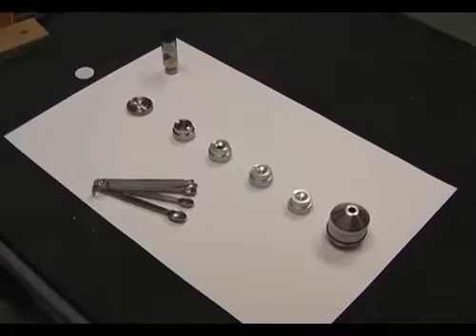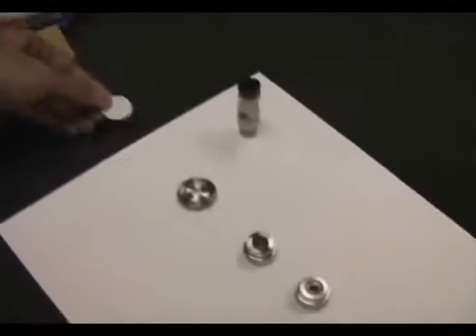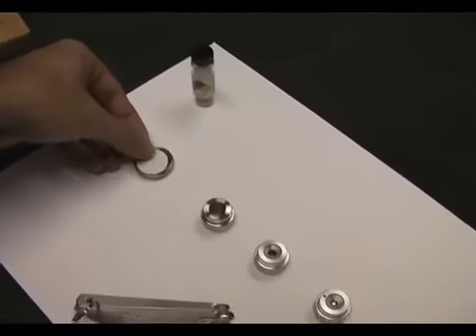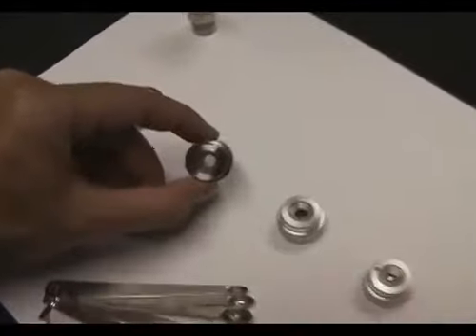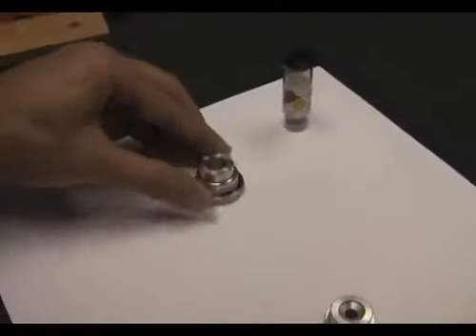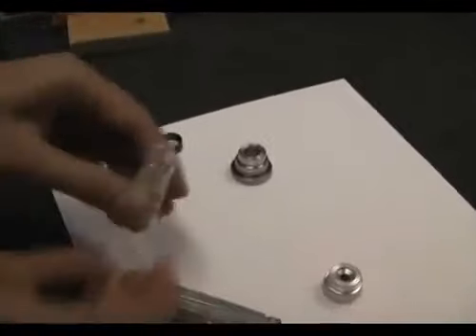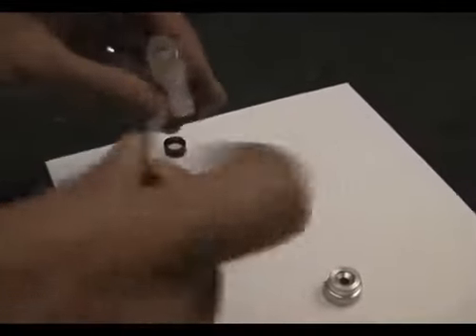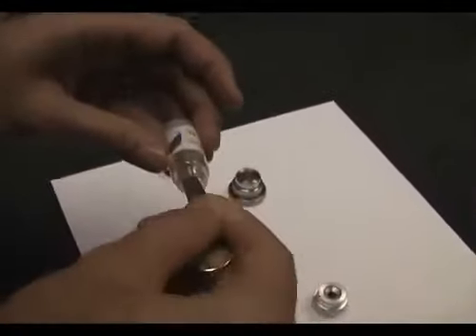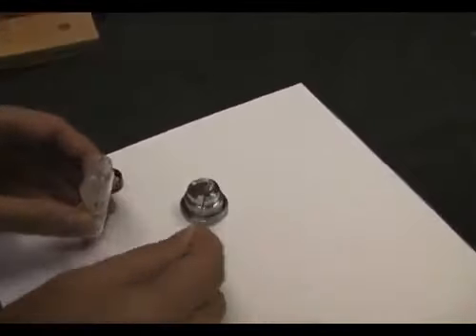Step is to prepare the sample inside the nozzle. First thing you do is you grab one of these little filters and put it on top of the base. Then you follow up with a sample holder, which is just a piece of metal with a hole in it. Then using one of the provided spoons, you go and collect a bit of your dust and just position it inside the chamber.